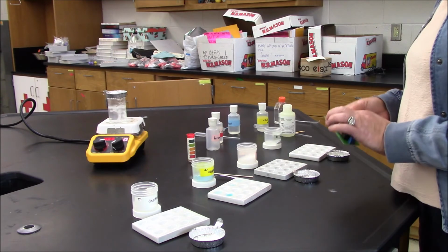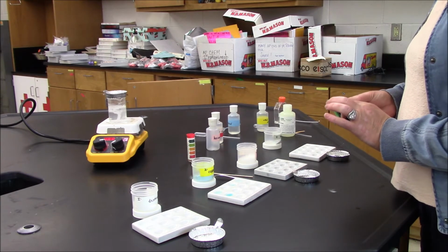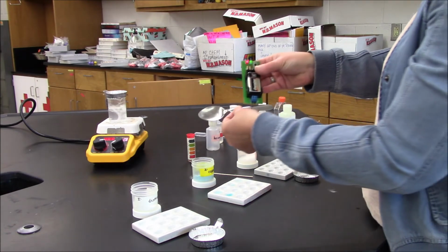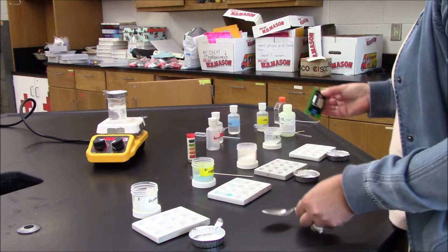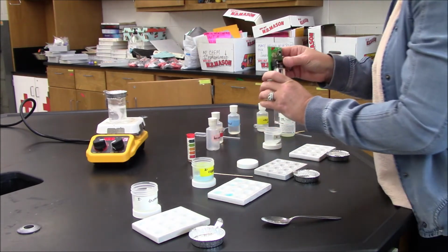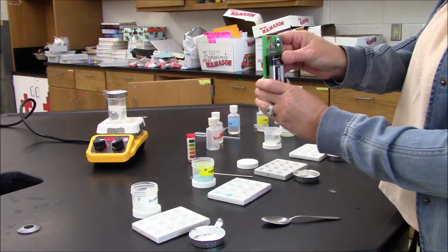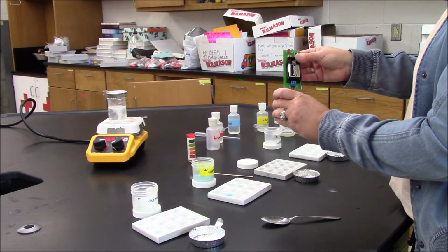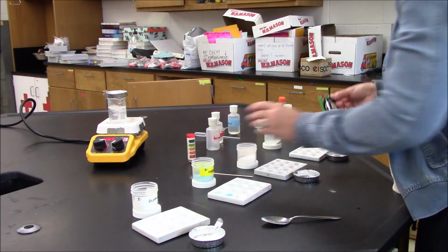It is a wax. The first thing that I'm going to do is check its conductivity. So I check my meter and it lights up. And I will put it in this wax and nothing happens. It is not a conductor in the solid phase.